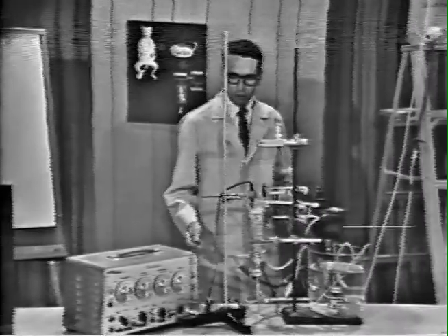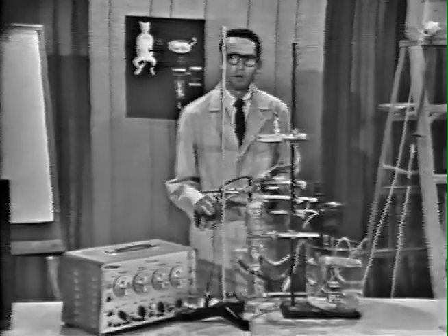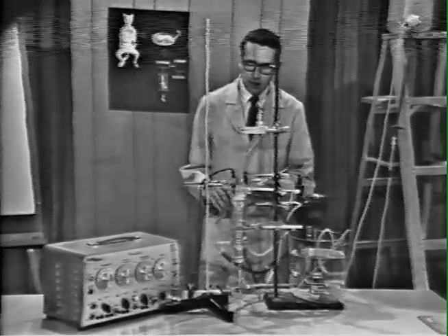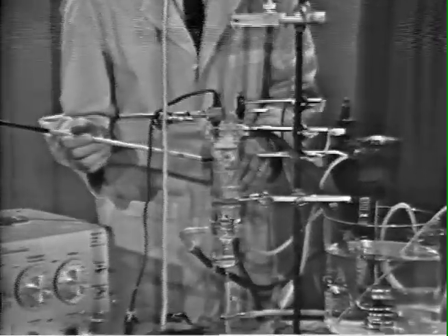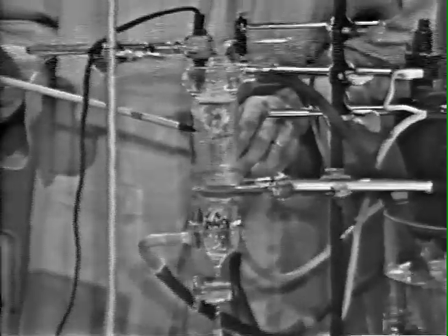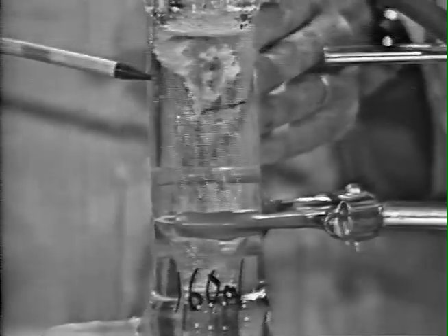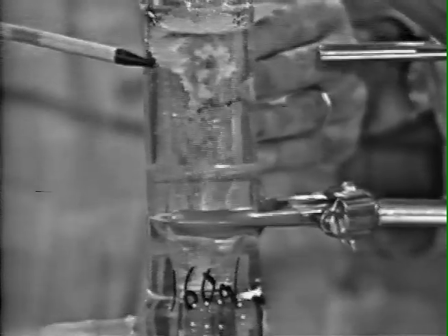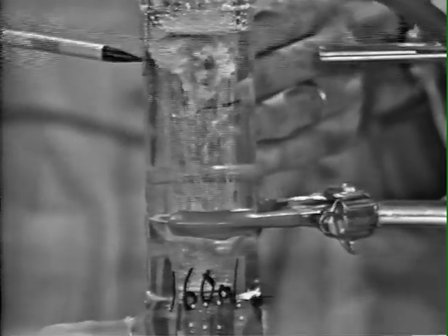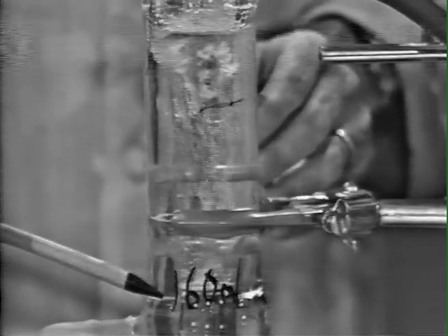We can briefly take a look here at the apparatus that is involved in obtaining the responses. The central portion of the apparatus is the tissue chamber. That is, it's the bathing chamber in which we place the atria and maintain them. The atria are situated in Krebs bicarbonate solution, which is maintained at 37 degrees and vigorously aerated with a mixture of oxygen and carbon dioxide.